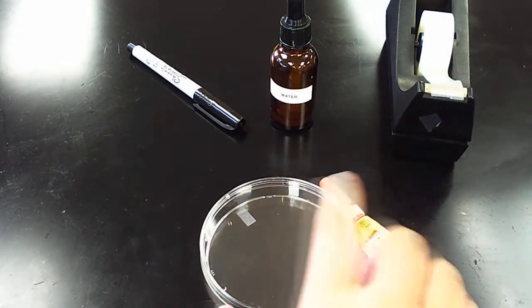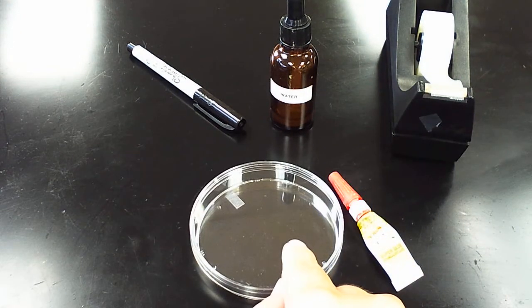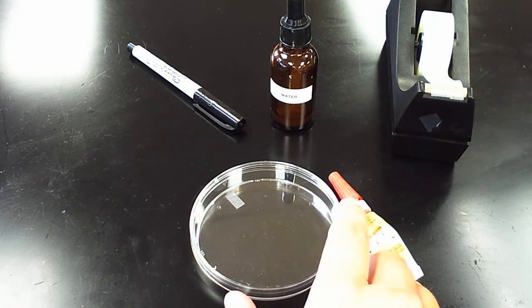At the station you will need a petri dish. It might be a big size one like this or it might be a slightly smaller one.